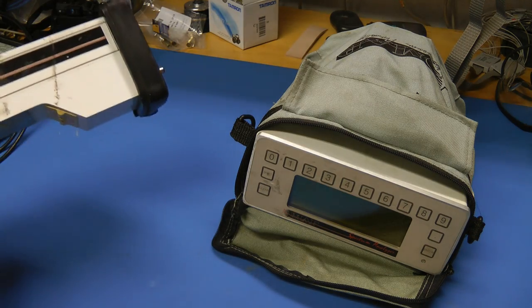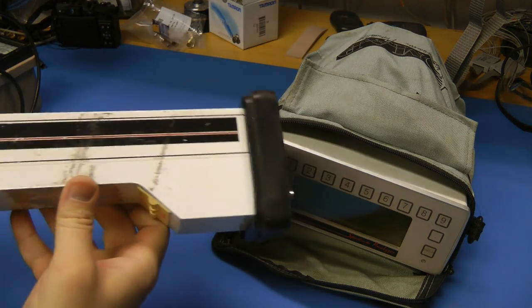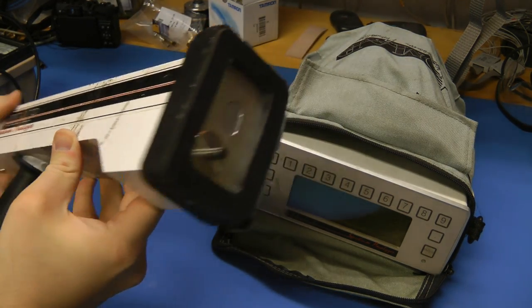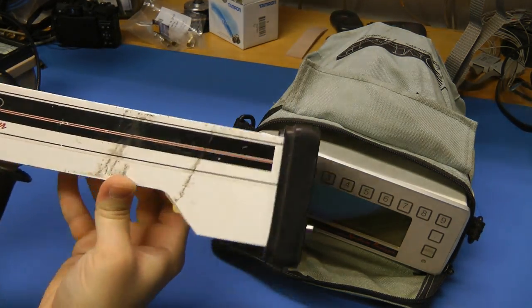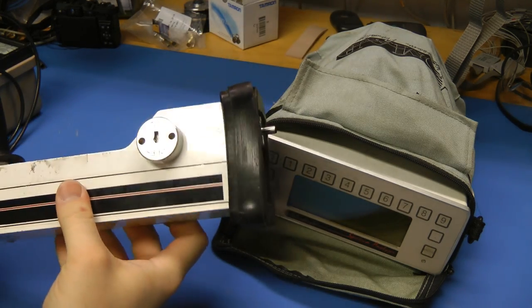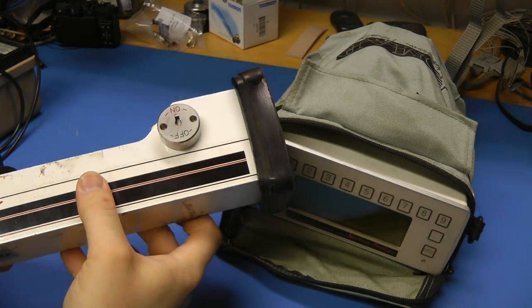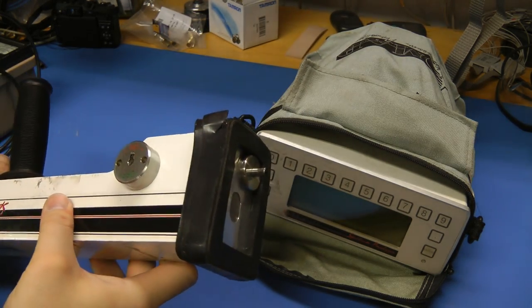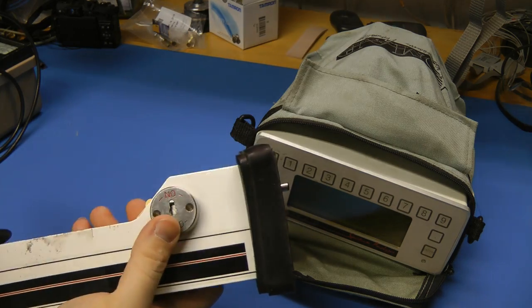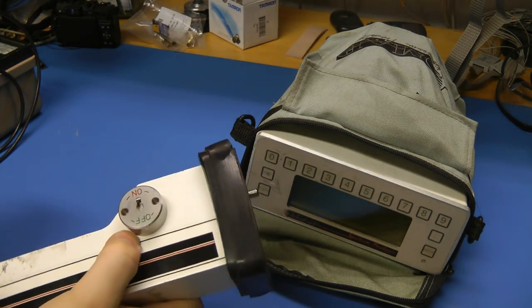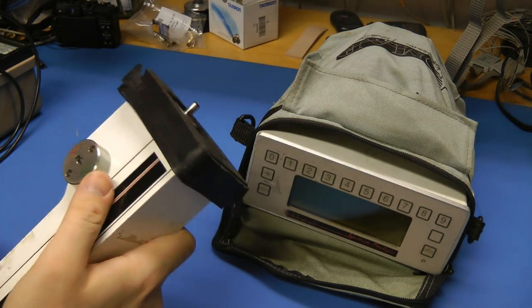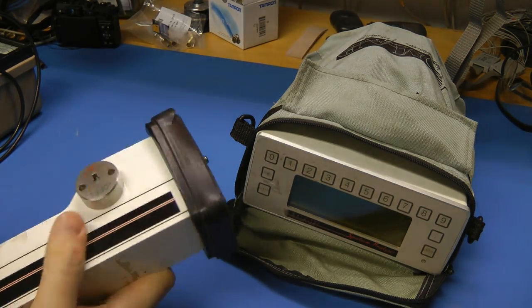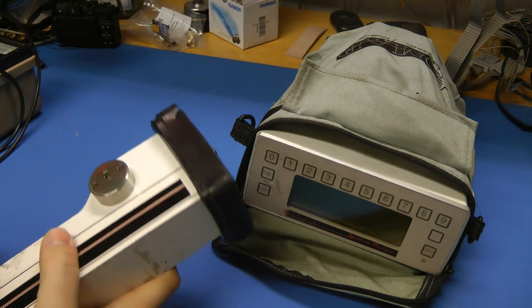When I was looking at this, I was initially wondering how they would fit an X-ray tube into this thing, given how small it is. And then I realized this actually has a radioisotope gamma-ray source in it, not an X-ray tube. So that's why this has taken so long to tear this down. I got this thing well over a year ago.